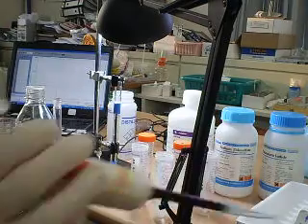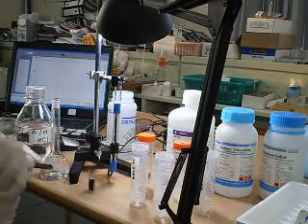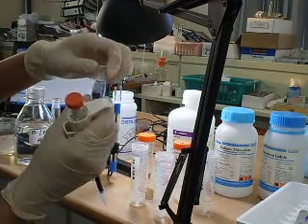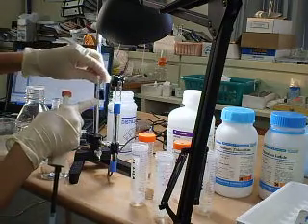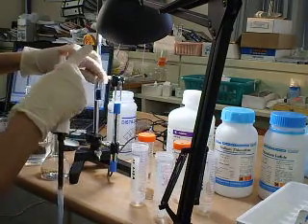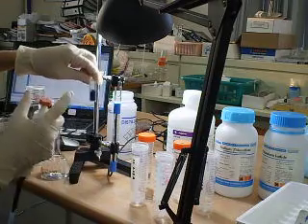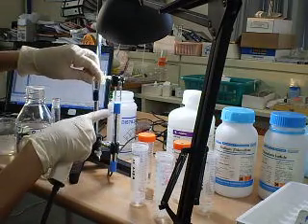I'm going to add hydrogen peroxide. The reaction will start and the blue-black coloration will start to form. Once this blue-black coloration starts to form, the light intensity will drop immediately. I'm going to measure the time it takes for the light intensity to drop.